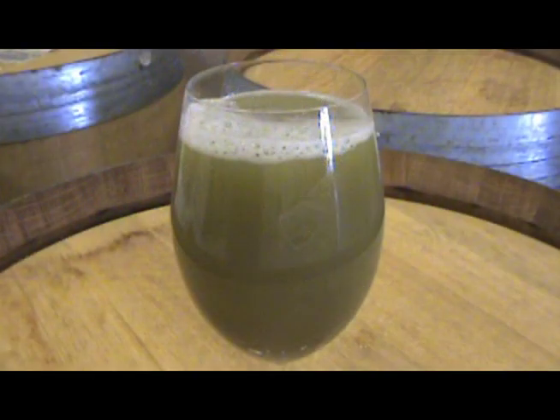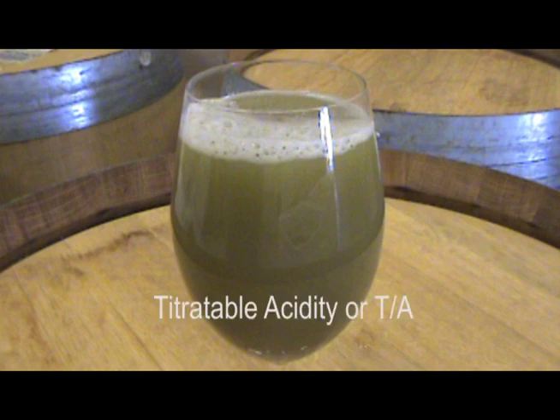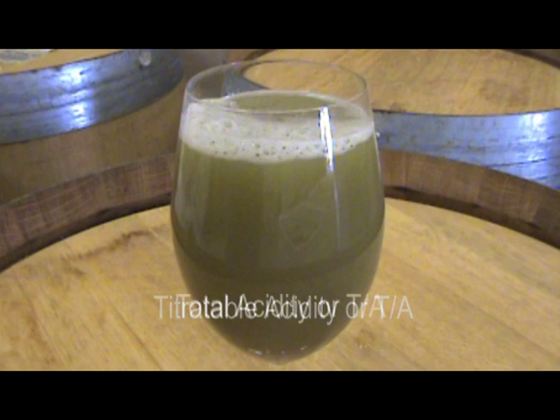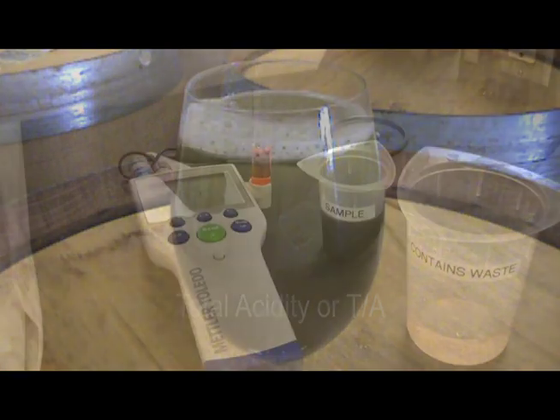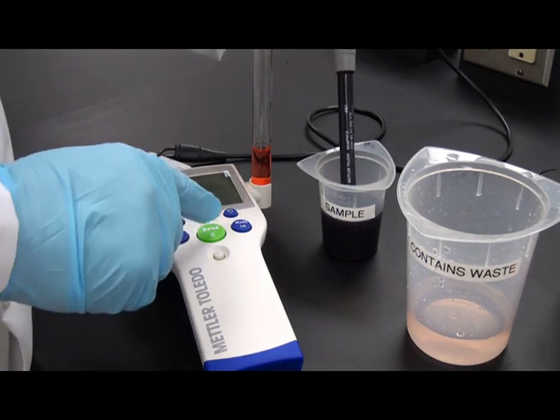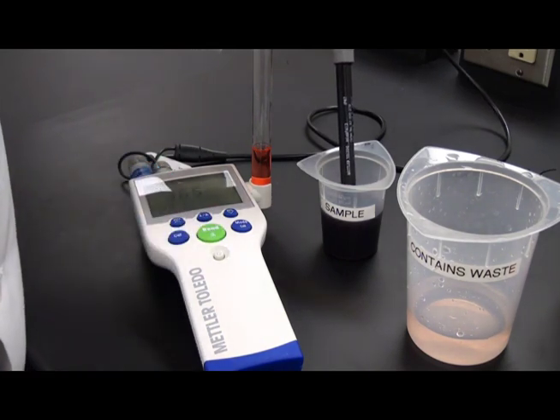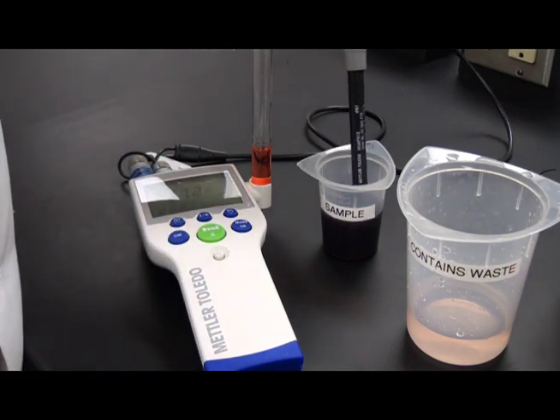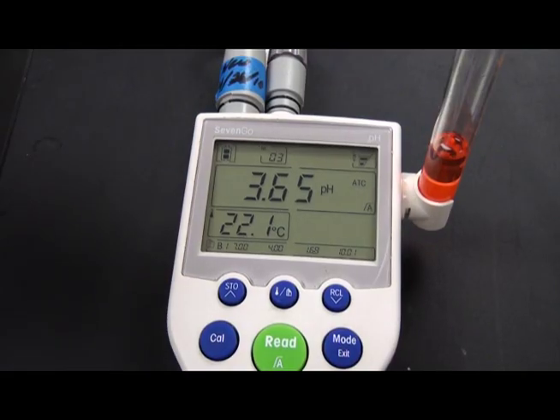One of the measurements of acidity in wine is known as titratable acidity, sometimes called total acidity, which refers to the amount of tartaric acid present in grams per liter, while strength of acidity is measured according to pH, with most wines having a pH between 2.9 and 3.9.